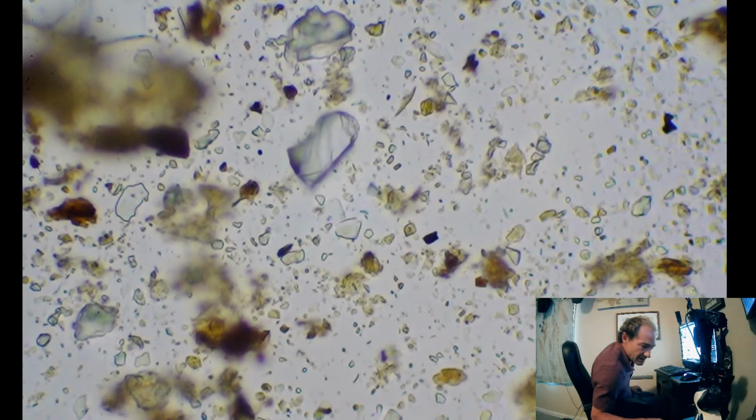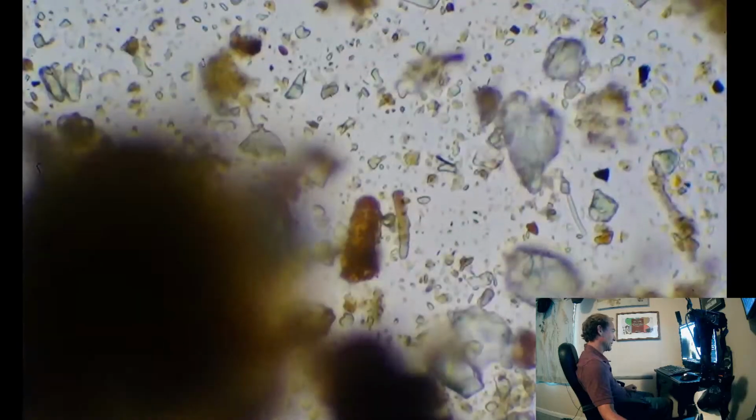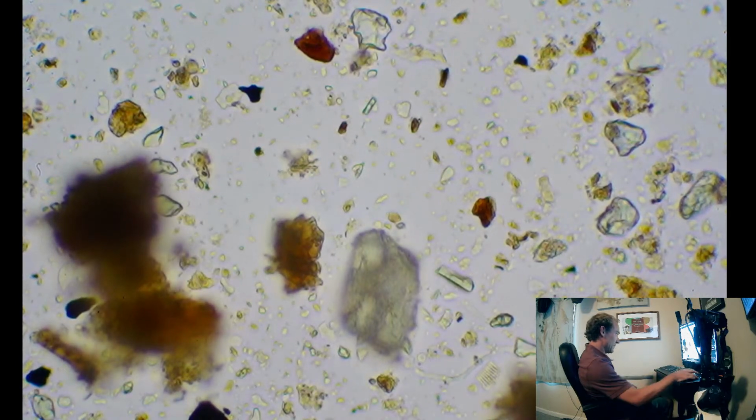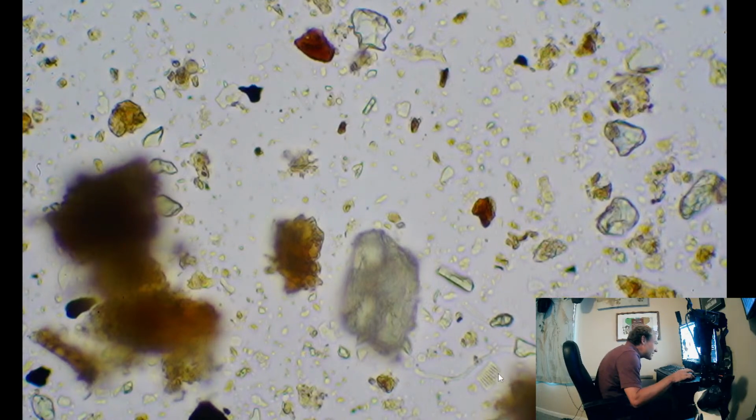Alright, where are we on this slide? I don't think we've gone down to the bottom yet. We keep on coming back up and circling around. Let's just go all the way down here and skip around, because we haven't looked down here at all yet. Another funky-ish looking strand.